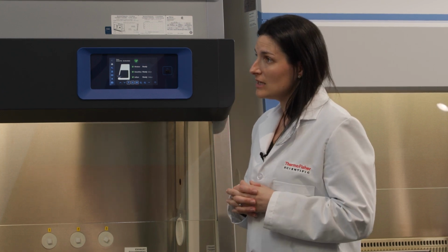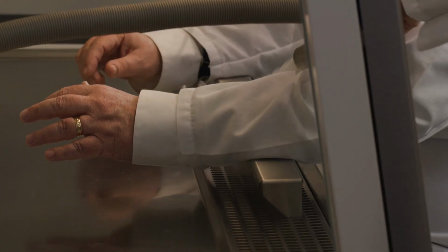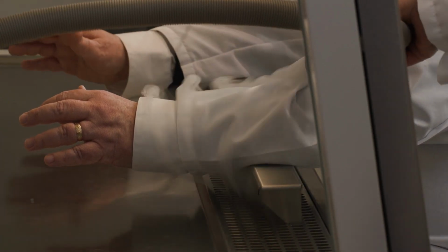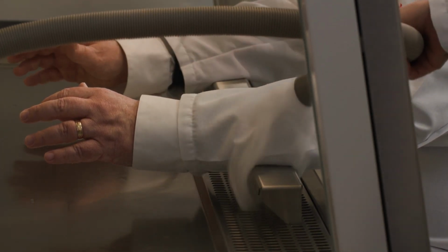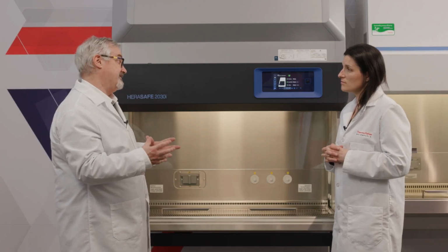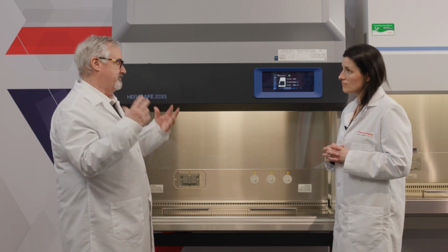The challenge for the user is to take their observation of stuff like the smoke studies and even the particle count and remember that as they work with the cabinets, it is behaving in exactly the same way. So they have to imagine as if smoke was going around their arms as they move around so that they're managing the particles and contamination the way they want. But it's a whole lot easier to have at least seen it once and try to visualize it versus just trying to visualize it from your own imagination. But it was a lot of fun.